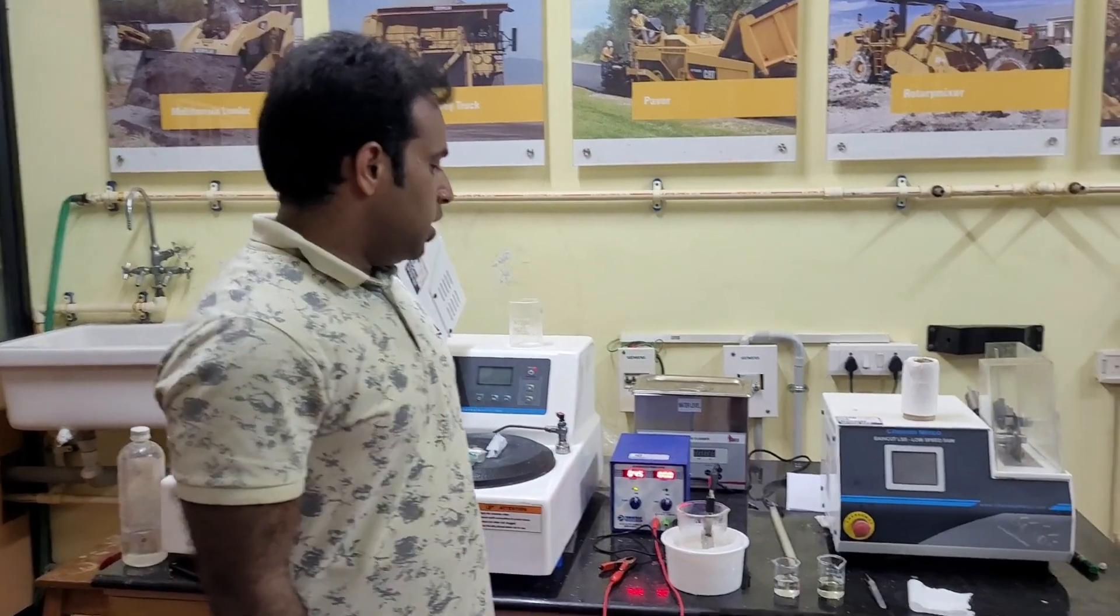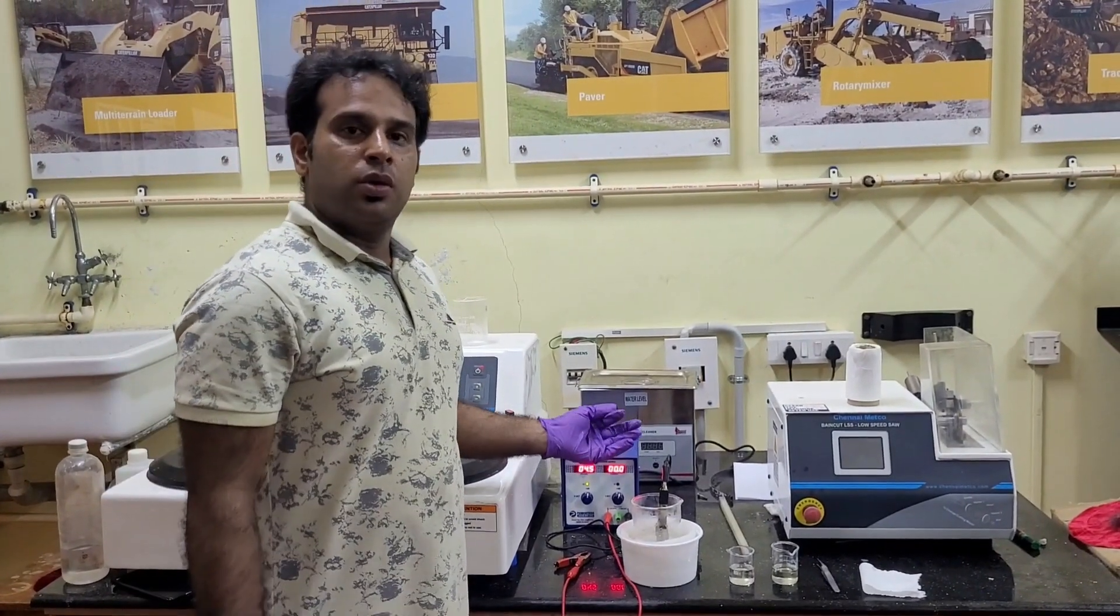Hello everyone, today we are understanding, doing the experiment known as electropolishing.